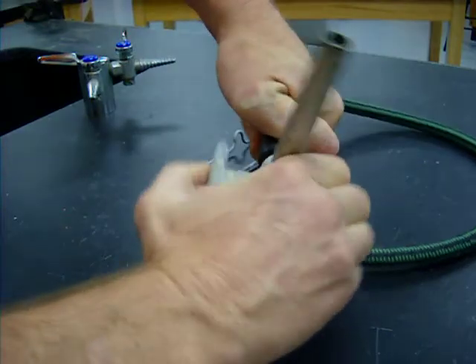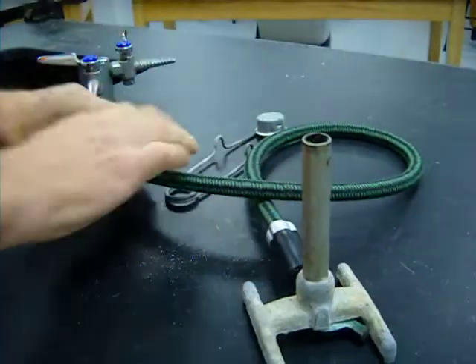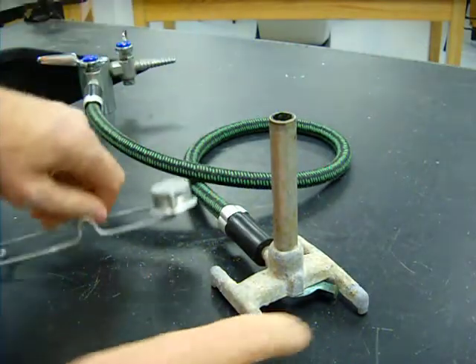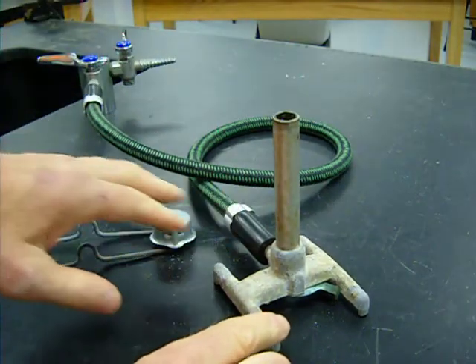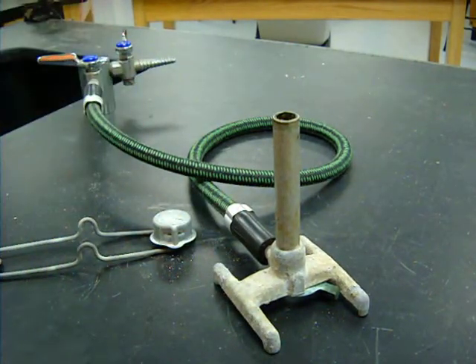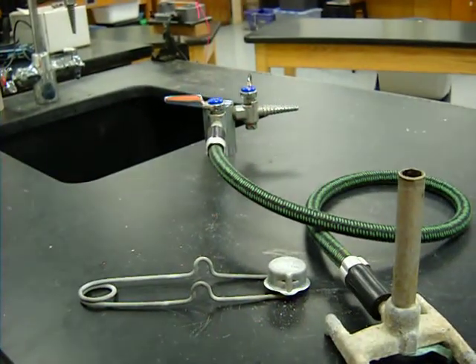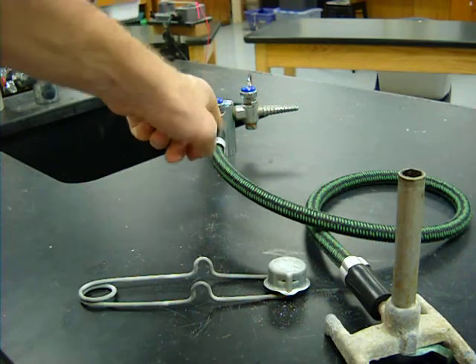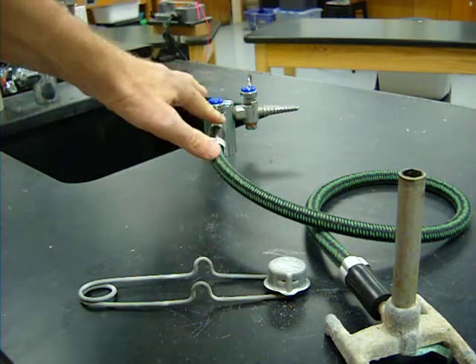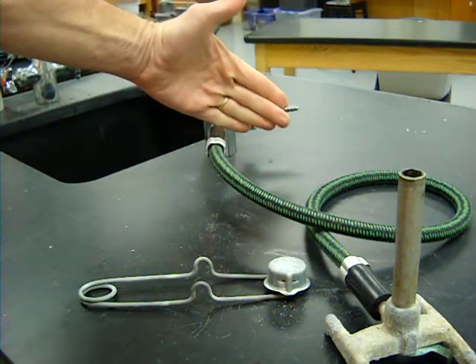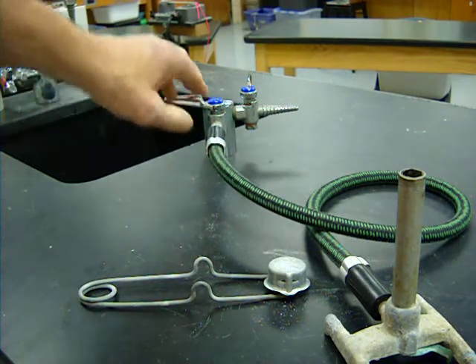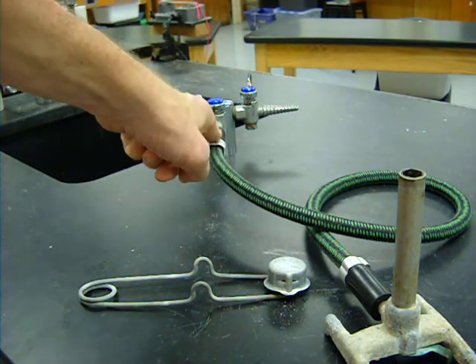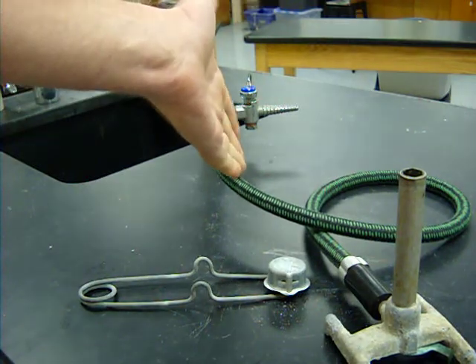I'm going to connect my hose nice and tight at both ends. Let's take a look at the valve. The valves are such that if the handle is 90 degrees to the gas outlet, the valve is off, like it's cutting off the gas supply. In order to turn it on, I have to turn the gas handle parallel to the outlet to allow the gas to flow through.